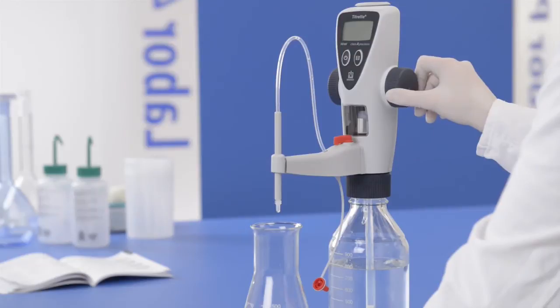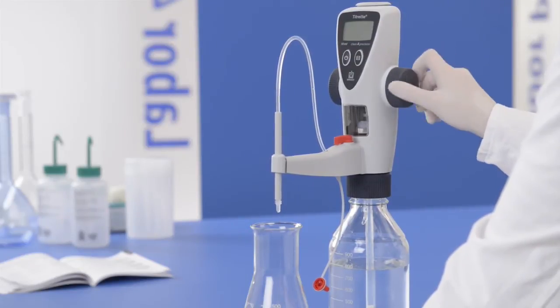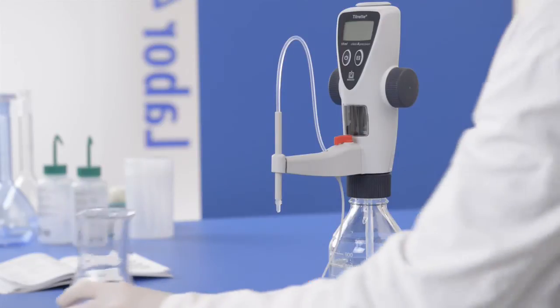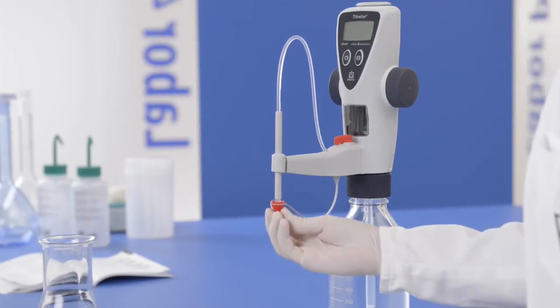Then dispense into a receiving vessel until all the bubbles are removed. Screw the cap back into place.